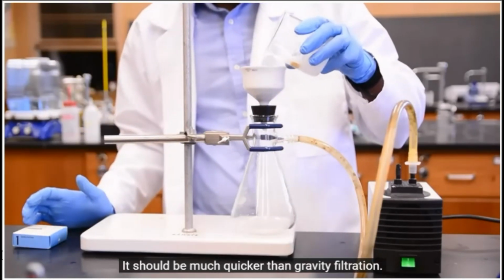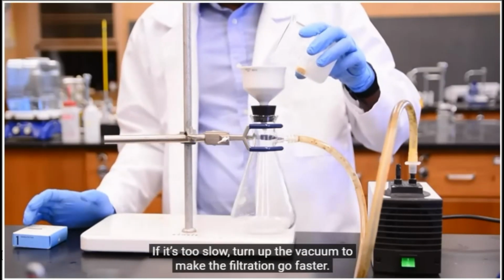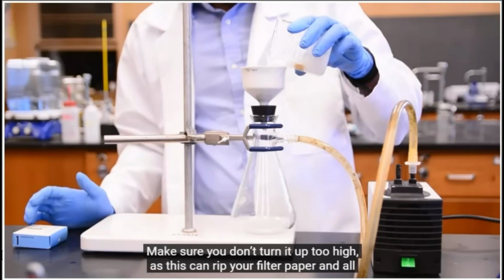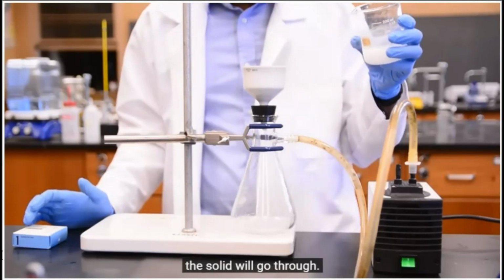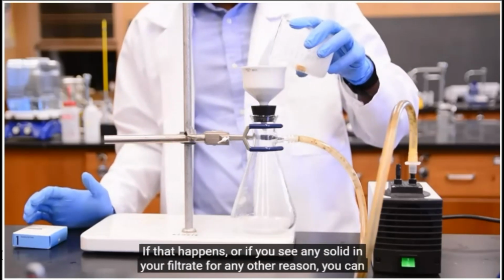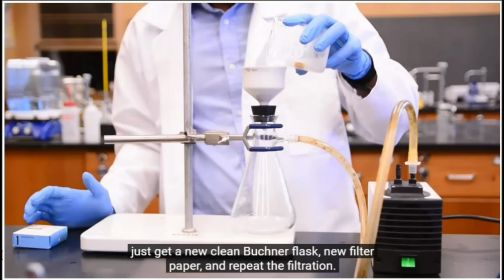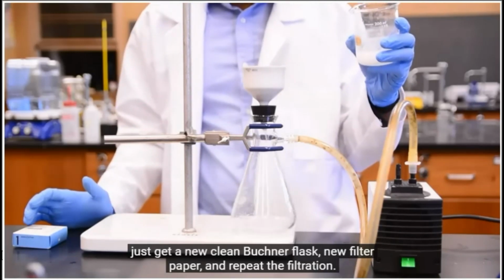It should be much quicker than gravity filtration. If it's too slow, turn up the vacuum to make the filtration go faster. Make sure you don't turn it up too high, as this can rip your filter paper and all the solid will go through. If that happens, or if you see any solid in your filtrate for any other reason, you can just get a new clean Buchner flask, new filter paper, and repeat the filtration.